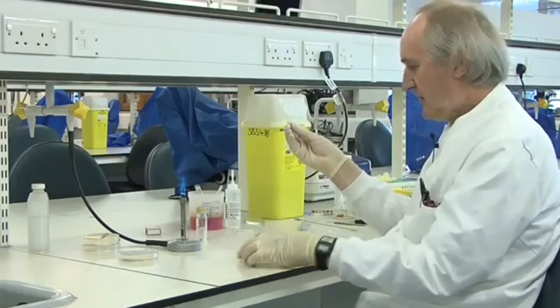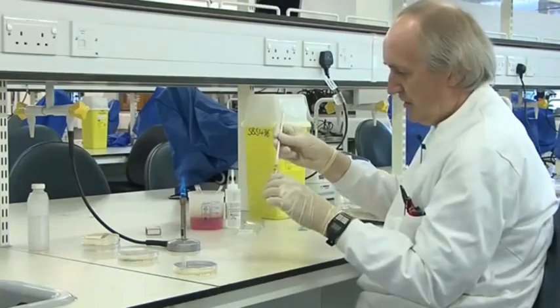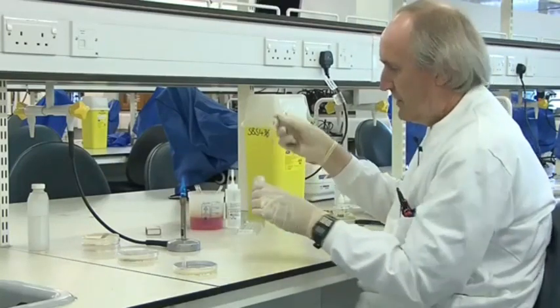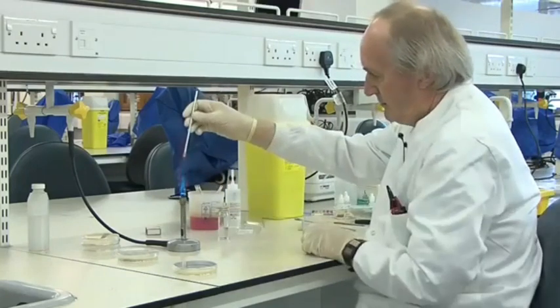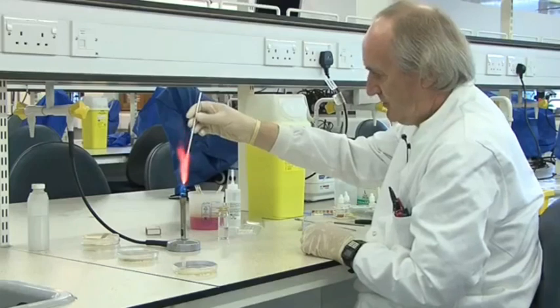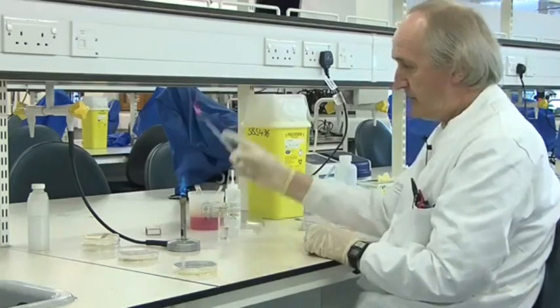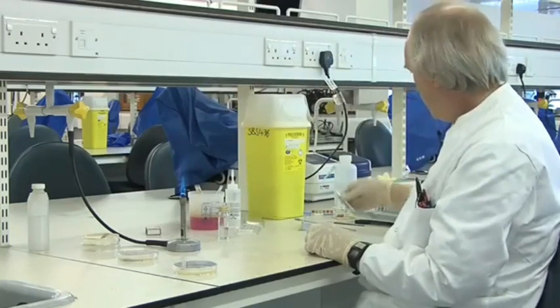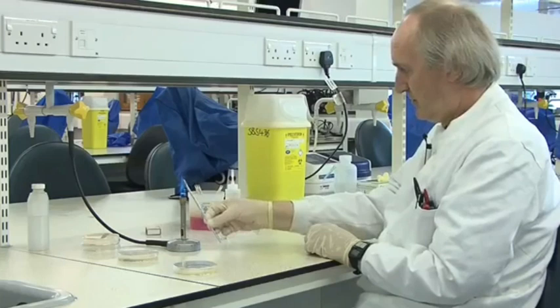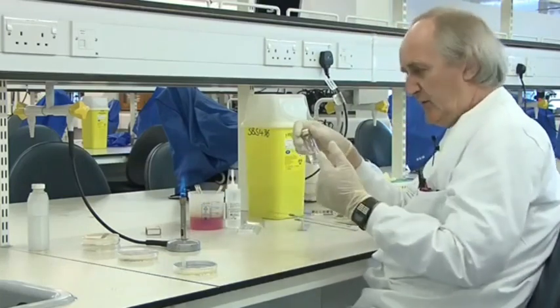You can't do an identification on a mixture. Take the top off, flame it, shake off the colony into the 10 mils of sterile water, flame again, re-sterilize the loop. Some people say you should sterilize the loop that way so you don't burn your hands — I've always done it differently for years and never burnt my hands — but that's slightly safer. So now I've got an emulsion of one type of bacterium.